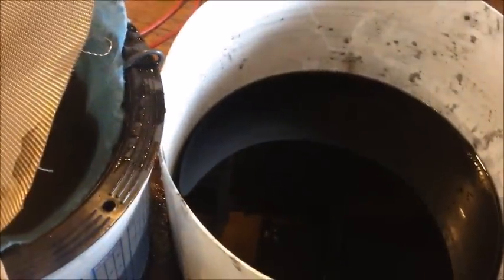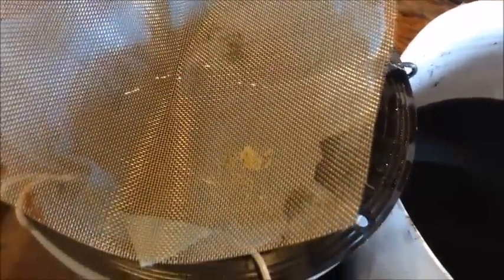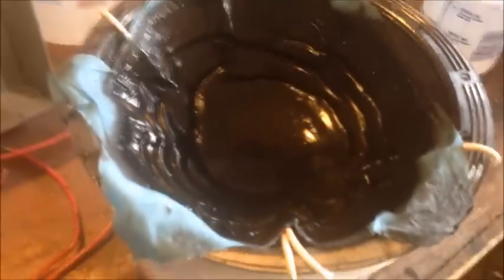At the bottom of the solution you can see all the black sludge, and there are also some copper flakes that come off the cathodes during plating. So I'm using a piece of about 30-mesh stainless steel screen to pour the anode slimes through — it'll catch any of those big pieces of copper so we're not fighting copper contamination when we smelt down the anode slimes, because that would be counterproductive.